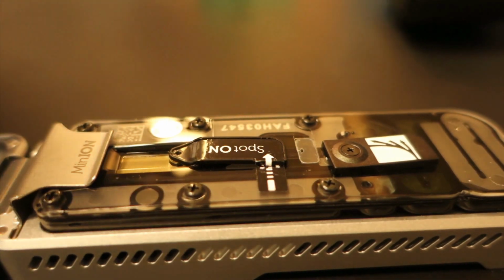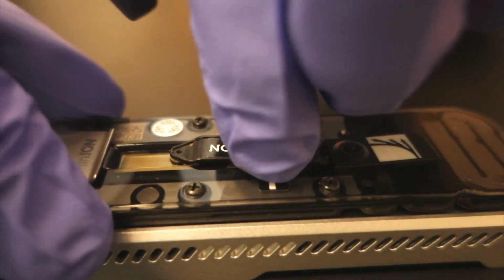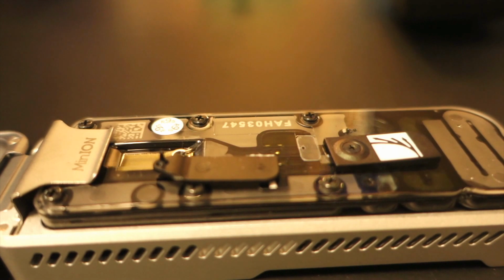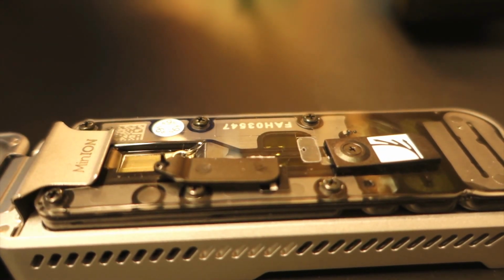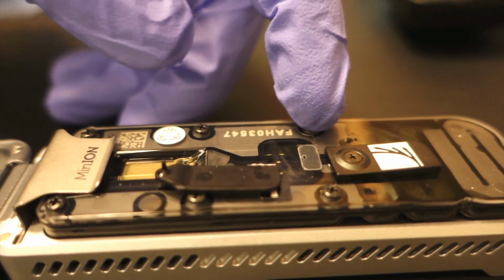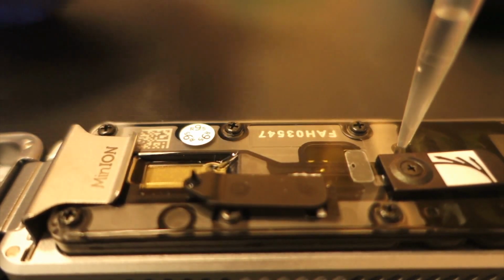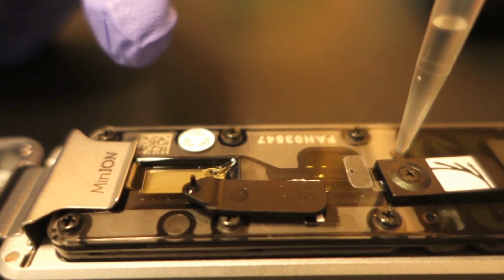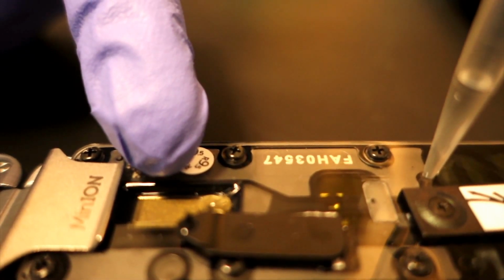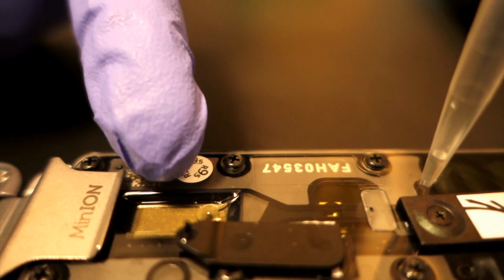After the 5 minutes has elapsed, set our pipette to 200 microliters and then open the SpotON cover that is covering up the loading port here. Now we take 200 microliters of buffer and we're going to slowly add it to the priming port here in the same manner we did the 800 microliters of buffer, taking care not to introduce any bubbles. Now as we slowly load this in, we'll see buffer rise and fall again here at the loading port. Make sure you load this buffer very slowly so that this buffer doesn't spill out all over the port here.